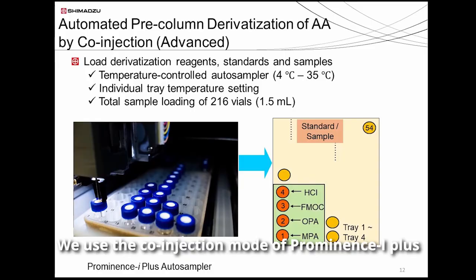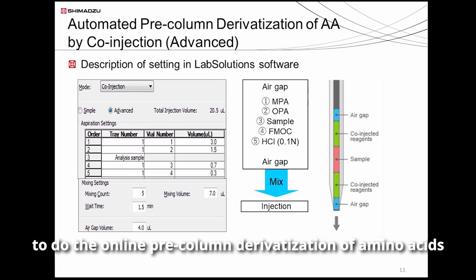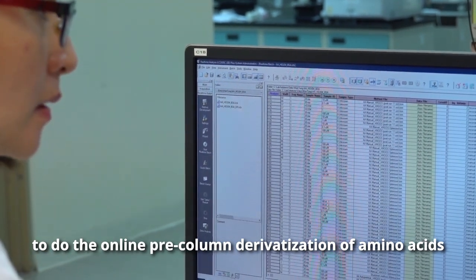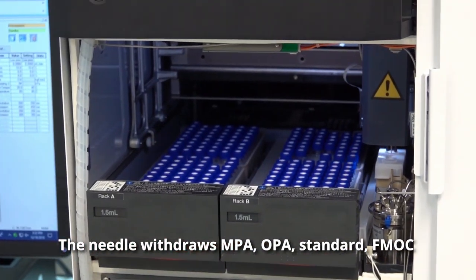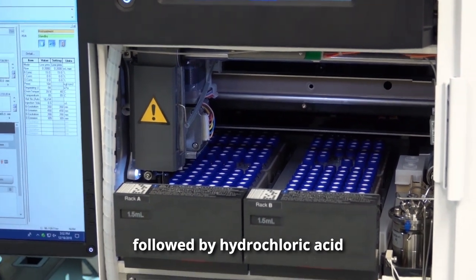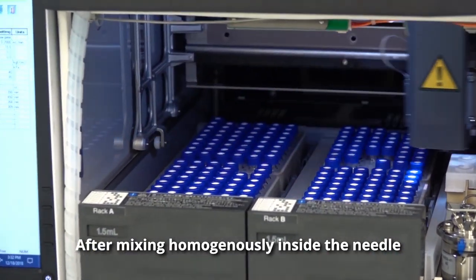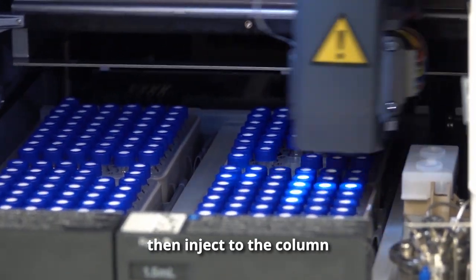We use the co-injection mode of the Prominence i-Plus to perform online pre-column derivatization of amino acids. The needle withdraws MPA, OPA, standard, and FMOC, followed by hydrochloric acid. After mixing homogeneously inside the needle, the mixture is then injected into the column.